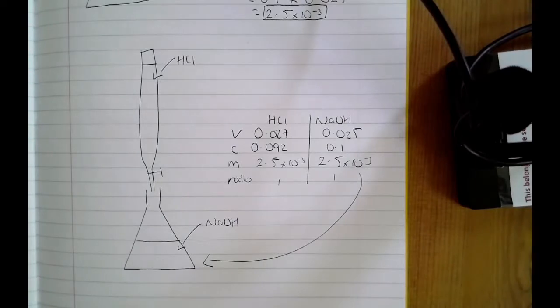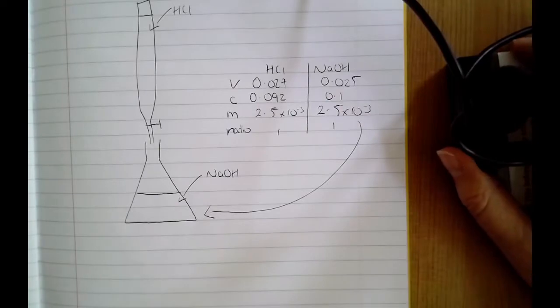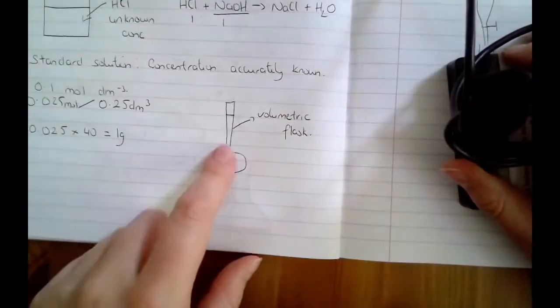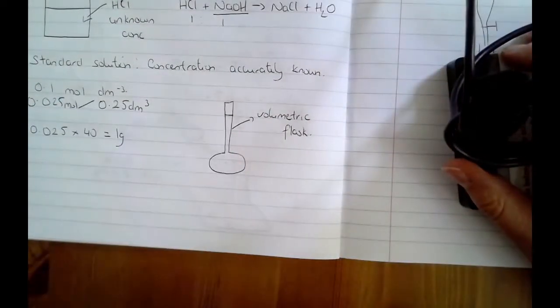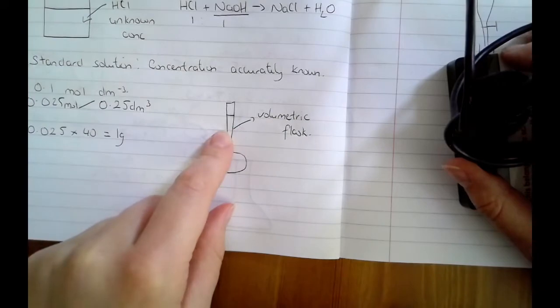There's just a few things I want to point out in terms of the accuracy of the titrations. So one of the things that the more basic questions can ask you is just in terms of the glassware itself. They can give you a method and ask you what the student did wrong. If they're talking about making a standard solution, the glassware should always be a volumetric flask. You'd never make one up in a beaker or a conical flask because they don't measure volume accurately enough.